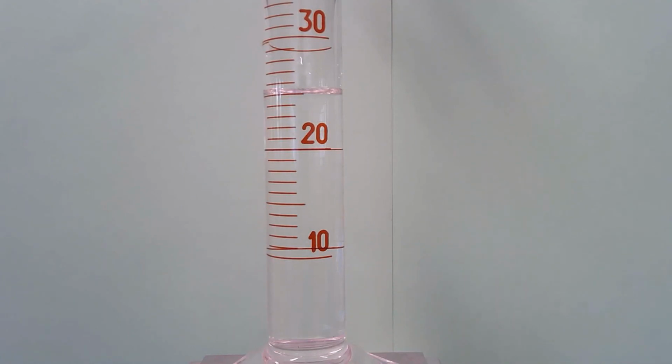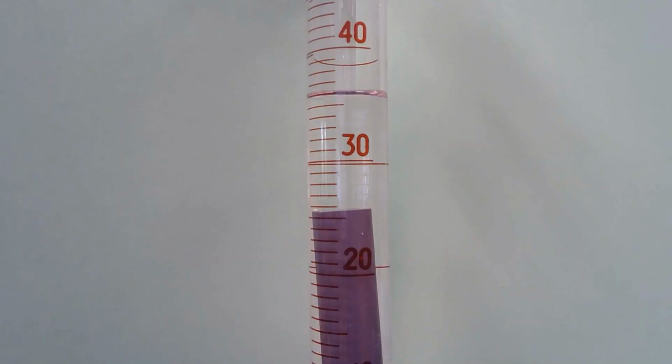The dark gray cylinder is not in there, so that is my initial volume. Go ahead and record what you see. Again, there's the meniscus. I'll drop the gray cylinder in and we'll get the change in volume. You see the dark gray cylinder in the graduated cylinder, the top of it there. Go ahead, read your volume, and see where the meniscus is. Use your estimation skills. You've got this. Record that as your final volume for the gray cylinder.